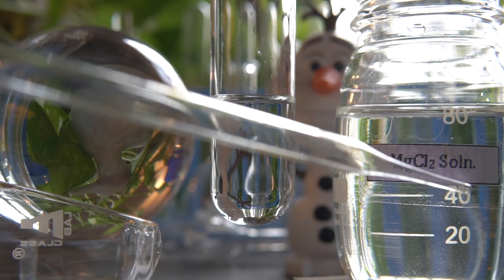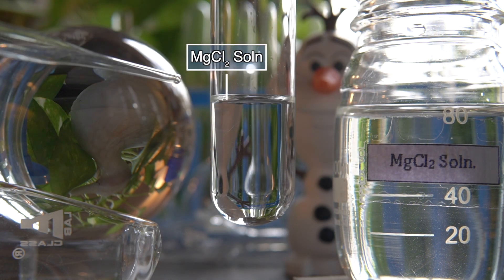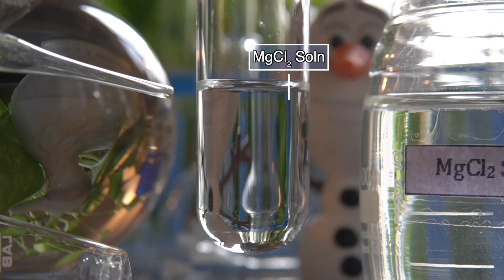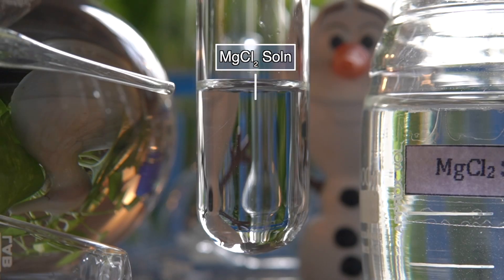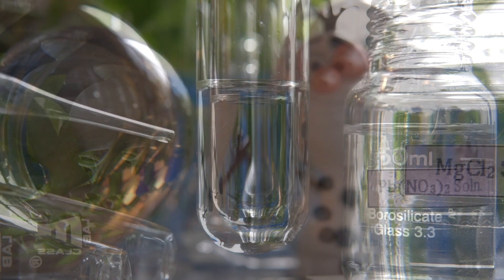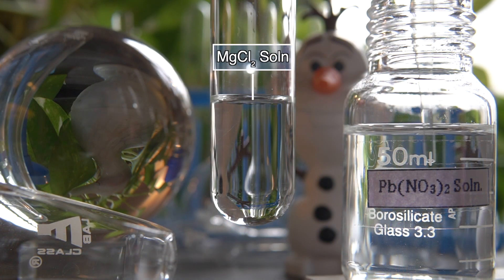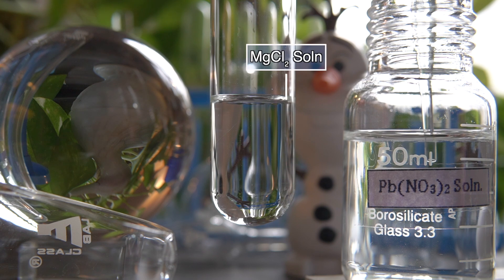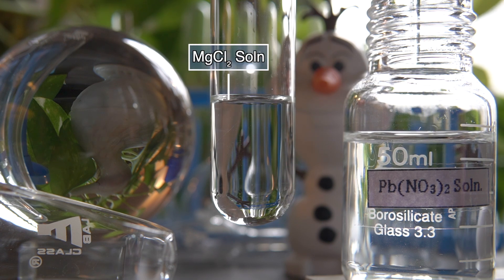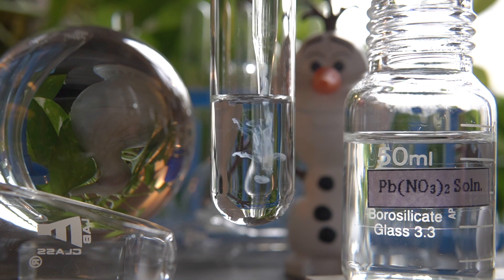Now to initiate the chemical reaction, we will take some amount of Magnesium Chloride into this test tube. Now we will add Lead Nitrate solution into the Magnesium Chloride solution slowly and observe the effect.